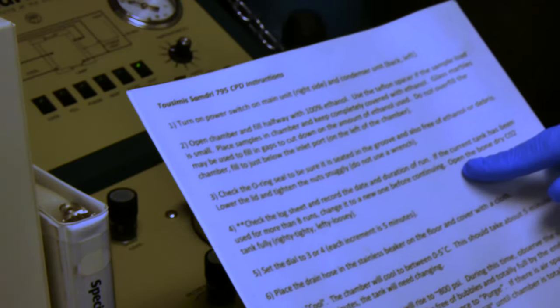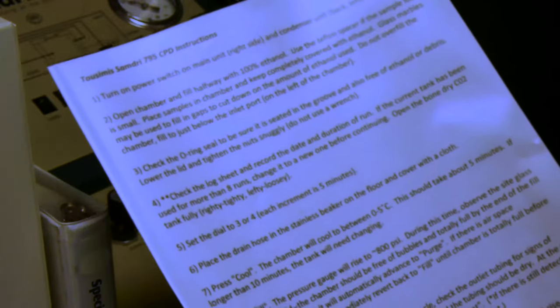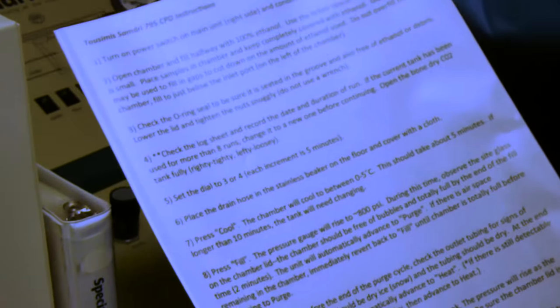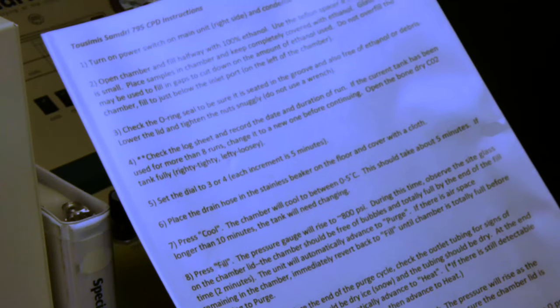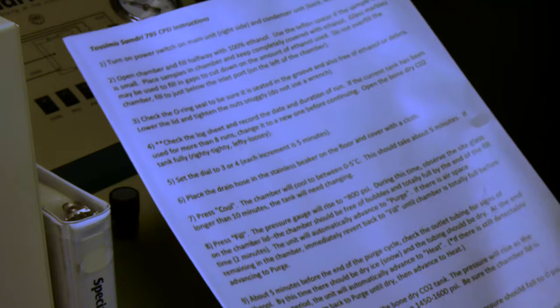And then the next step is to open the bone dry CO2 tank. This type of tank is actually a liquid CO2 that has a hose going down to the bottom where it is liquid. As the liquid level decreases, the gas in the tank will increase. And we want to go ahead and open this fully.